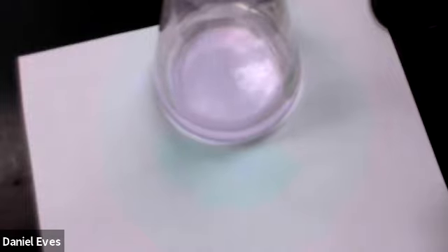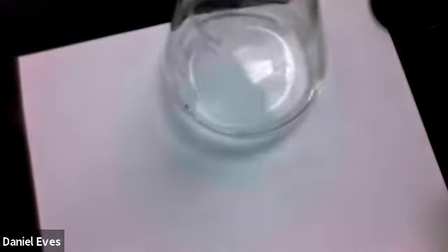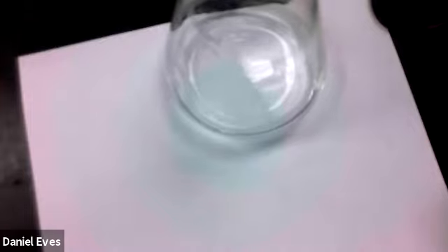We have one more portion to this lab. The last section of this lab is to use household vinegar. And we have a bottle of household vinegar here, and we have pipetted exactly 5 milliliters using one of these lovely volumetric pipettes, and I placed that inside of our Erlenmeyer flask, and then I've diluted it to 50 milliliters of water. And so we're going to go ahead and titrate that to figure out how much acetic acid there is in the vinegar.